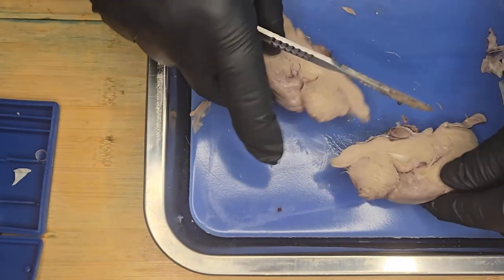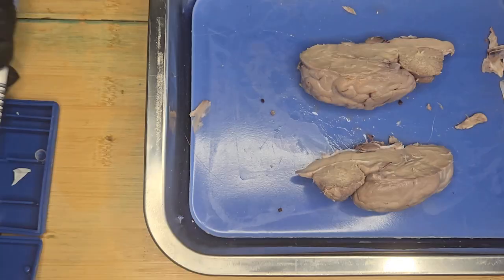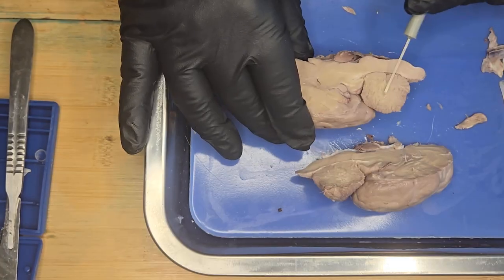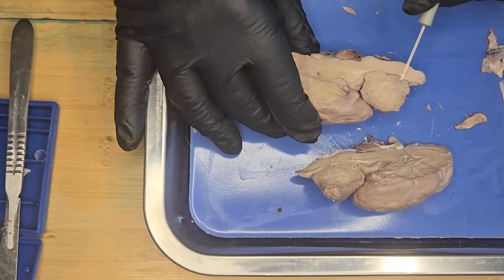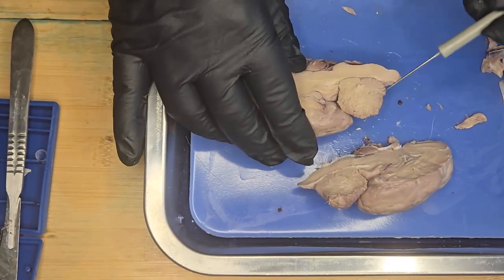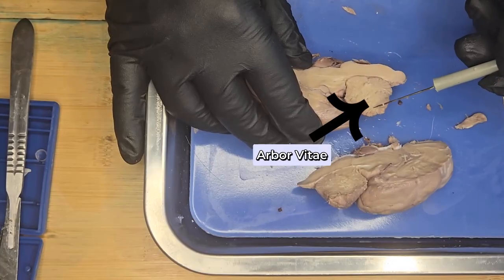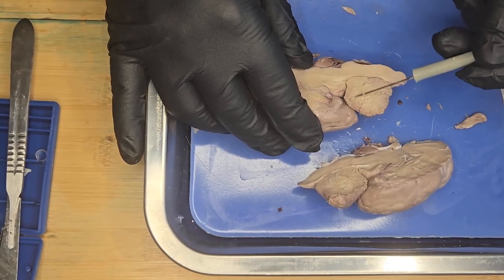Okay, wonderful. Okay, so now we can take a closer look at the internal structures of the brain. So here is the cerebellum, and this white matter in the cerebellum, it's very difficult to tell, but in the center bit, the white matter is called the arbor vitae. The arbor vitae, and you can see it's all branching out. This white material is branching out within the cerebellum.